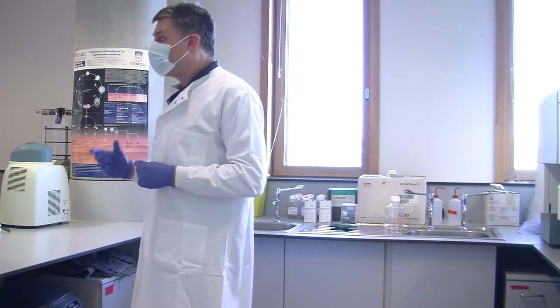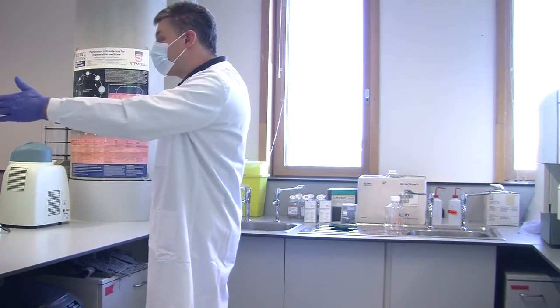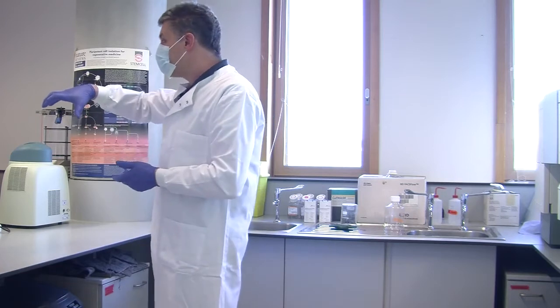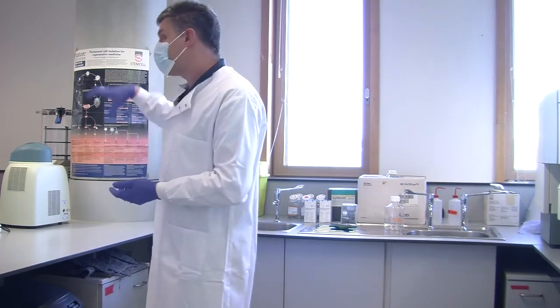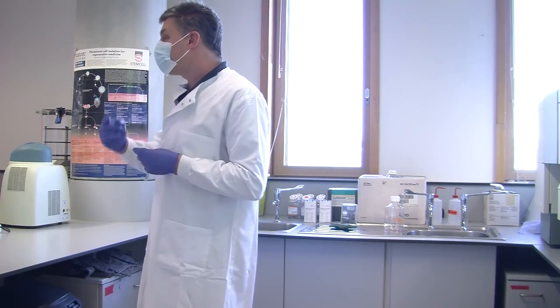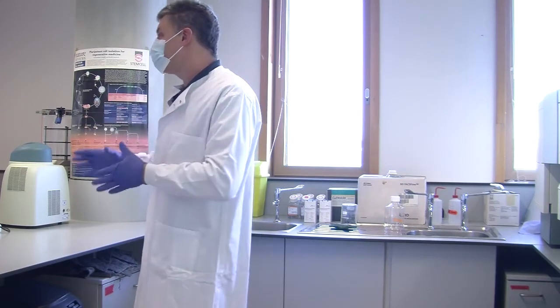And a drug company I know of in Slough has one of these instruments set up with a plate loading robot. It lifts plates out of a rack and loads them onto the instrument, and it runs them, and then the robot takes the plate away and puts a new plate on. So it's running all day, every day, every 3 minutes, well, every 5 with a wash, every 5 minutes it's doing a 96 well plate.